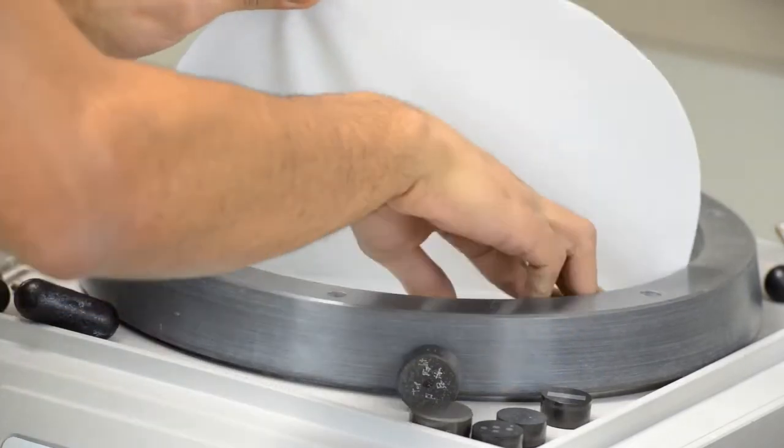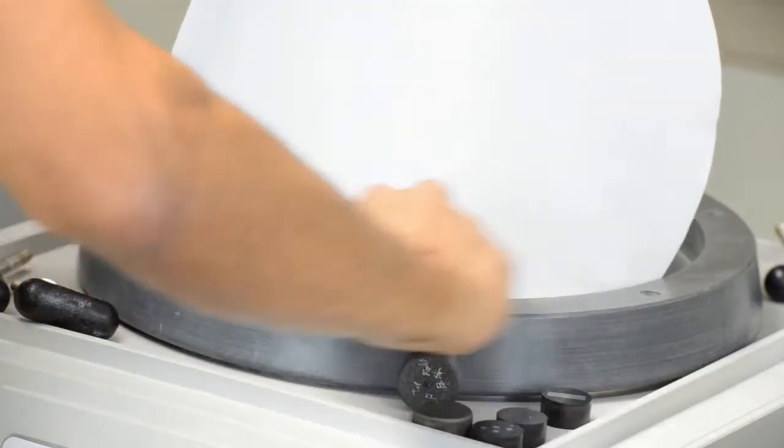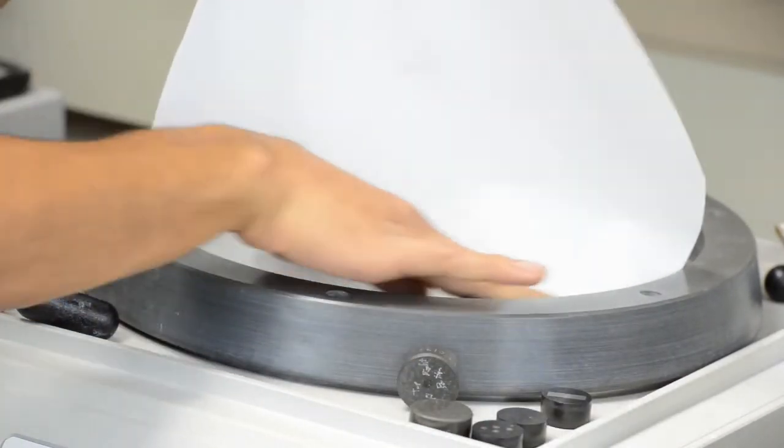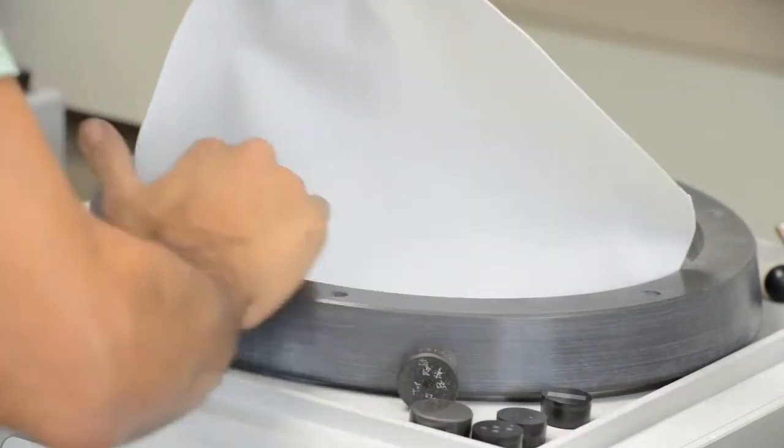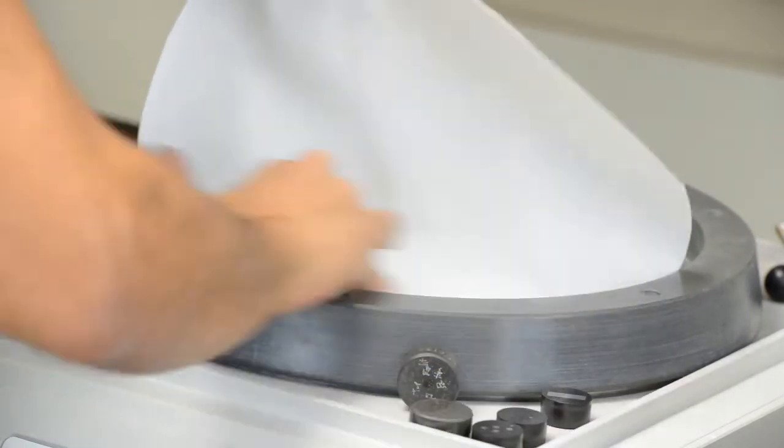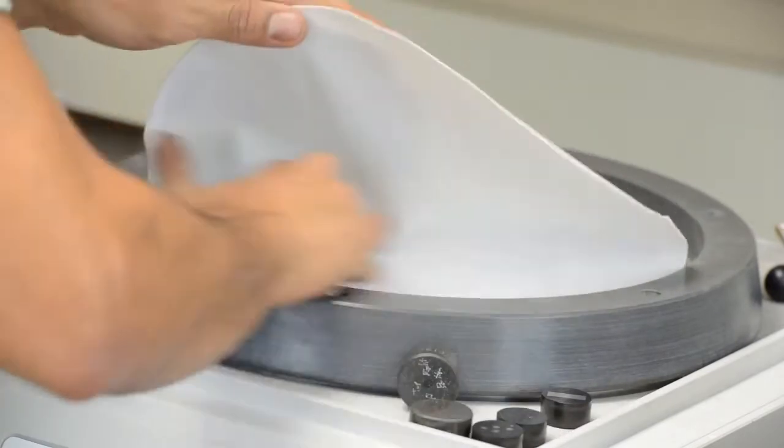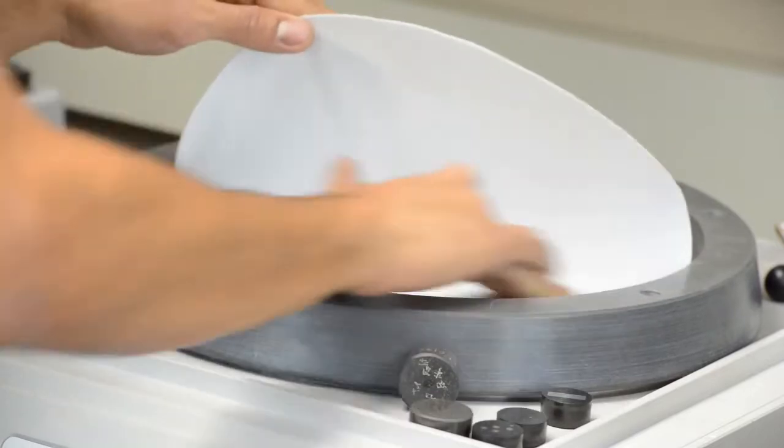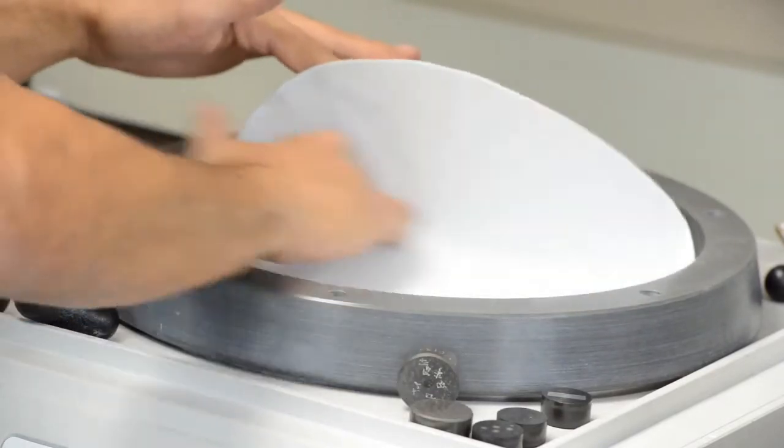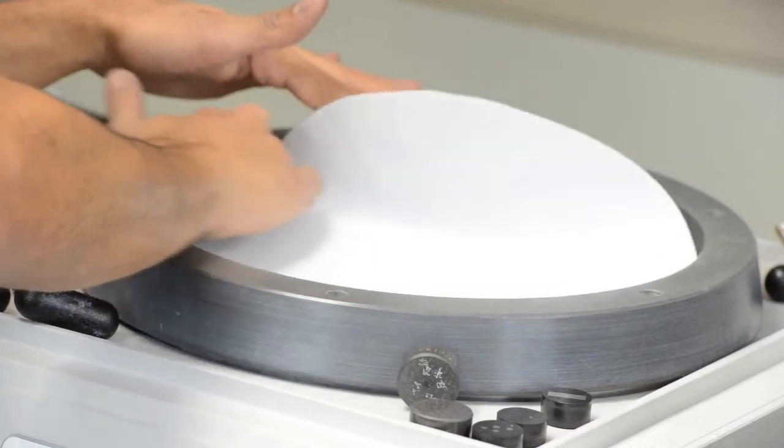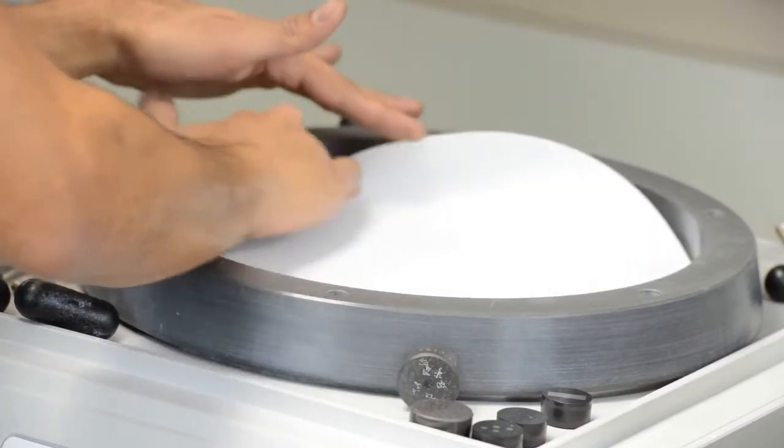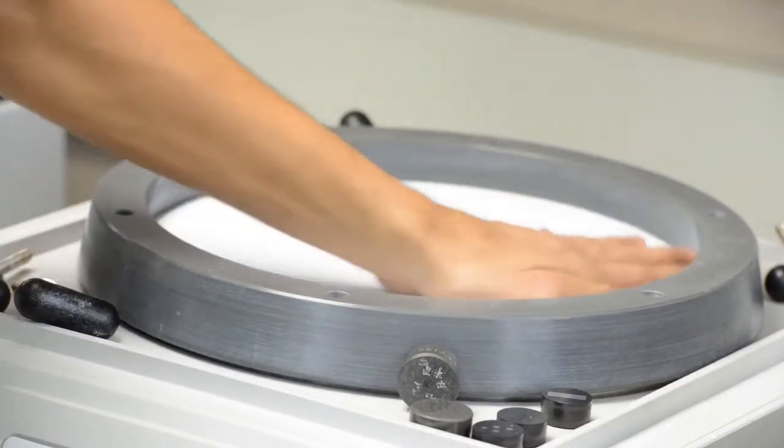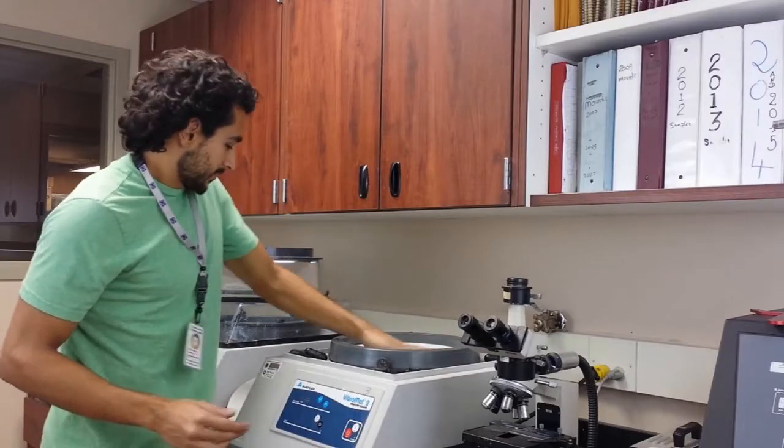Alright, so I let one side go. So now that I know it will fall in the center, I make sure that there are no bubbles, and I keep rubbing it as I go to make sure that there are no bubbles in between the pad and the bowl. Alright, keep going like that all the way to the end. And there you go. So that's, it's pretty, it's pretty good. There you go.